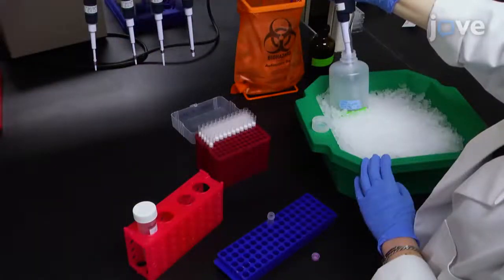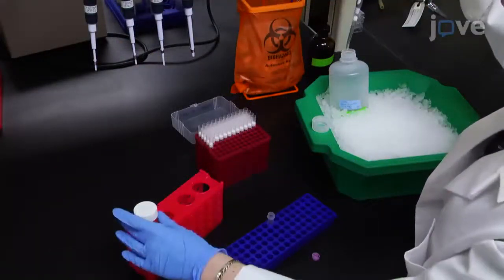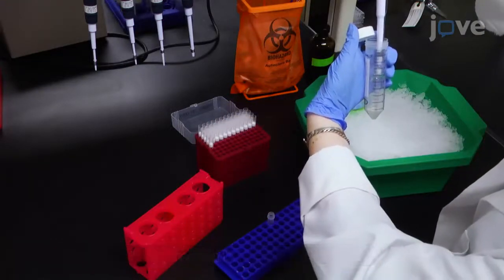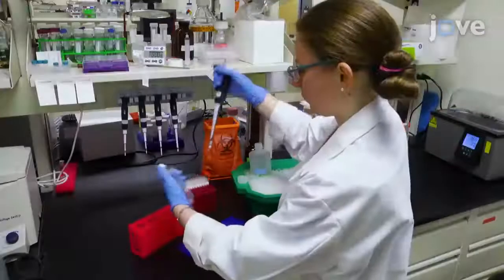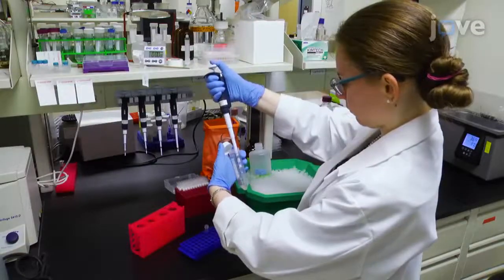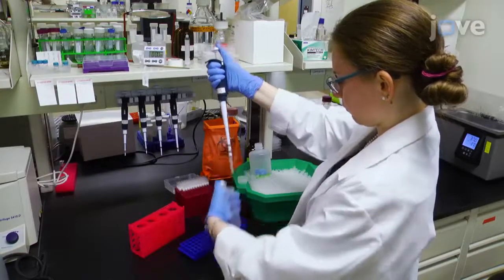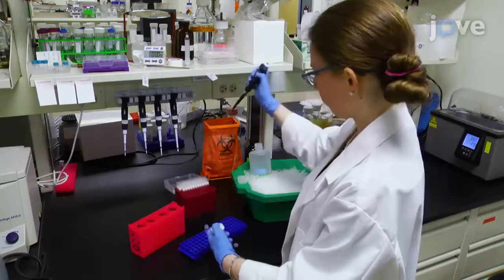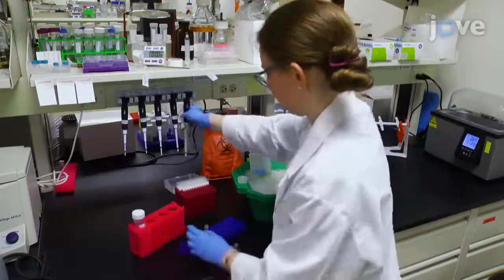Resuspend the cells in 800 microliters of TBSE with 1 millimolar PMSF and 0.5 milligram per milliliter lysozyme. Transfer the solution to a 2.0 milliliter threaded microcentrifuge tube with screw cap and O-ring prior to incubating for 20 minutes at 37 degrees Celsius.